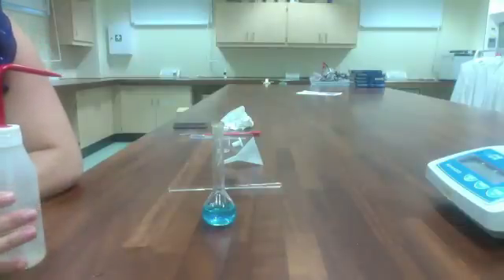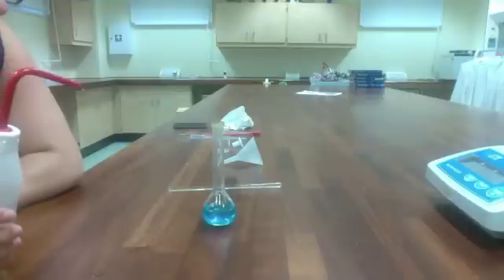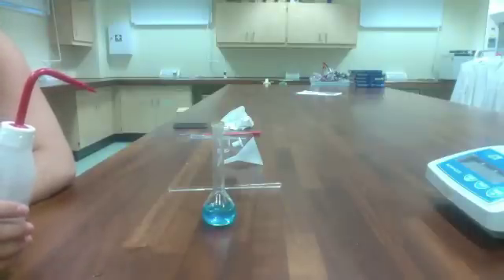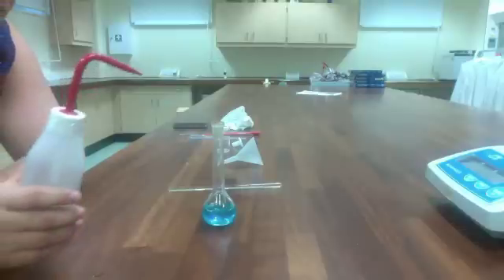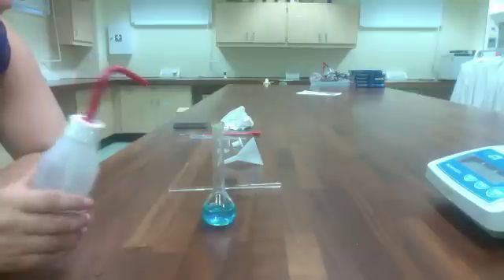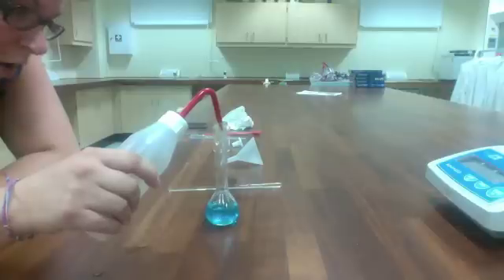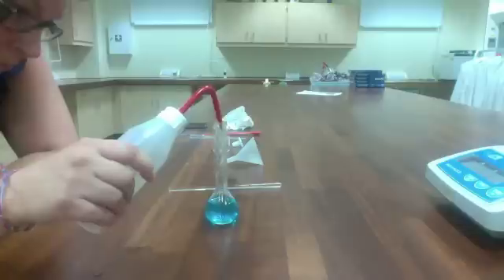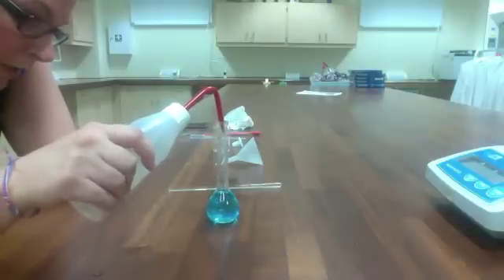Then we're going to make the solution up to the mark. That's a pretty chemistry-heavy term. All volumetric flasks have one marking on them. This is a 50 mL volumetric flask showing the 50 mL mark. We use volumetric flasks because they are way more precise than a grad cylinder or a beaker. I'm going to add some water until I get really close to the mark.